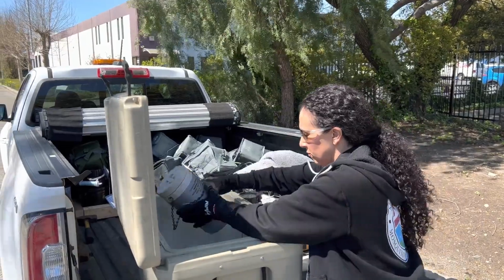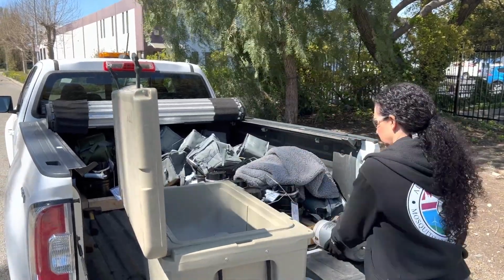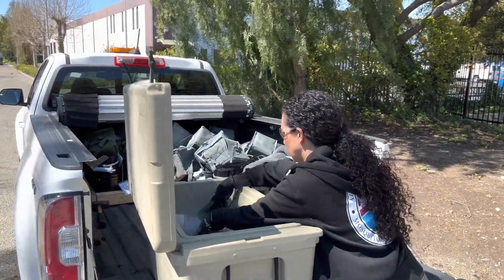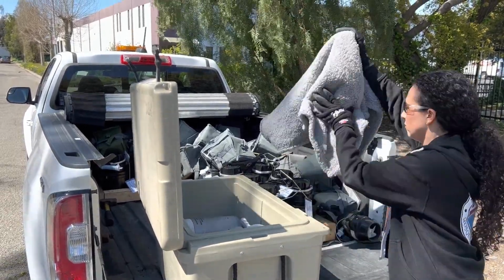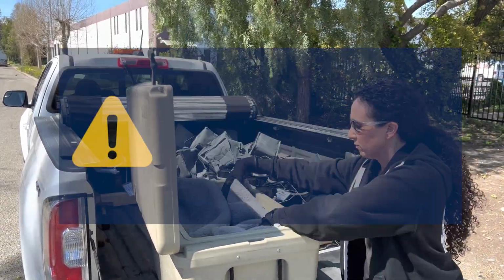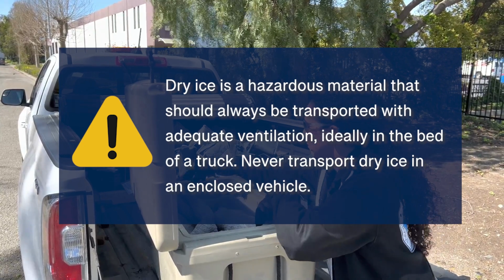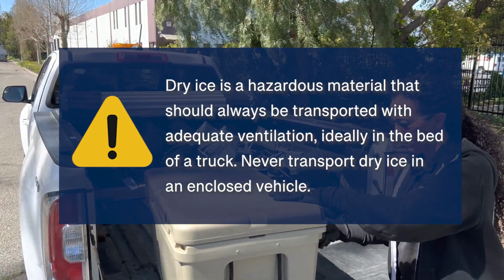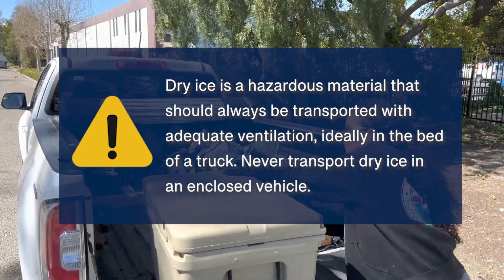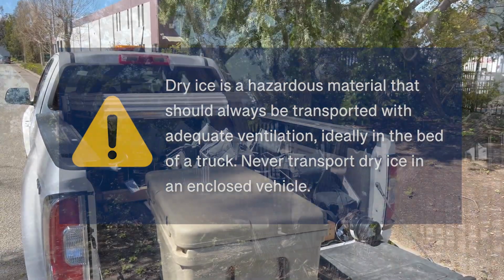Once all the containers have been filled for traps to be placed over the next few hours, put them into a large ice chest and optionally cover them with a blanket that will help keep them cold for longer. Dry ice is a hazardous material that should always be transported with adequate ventilation, ideally in the bed of a truck. Never transport dry ice in an enclosed vehicle.